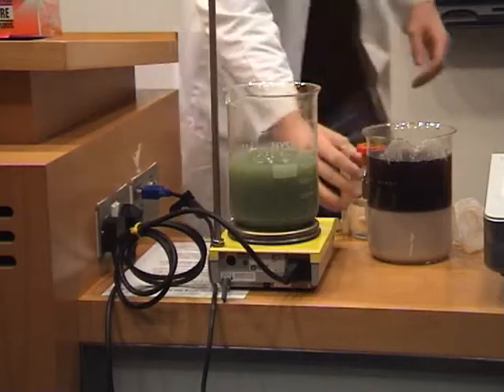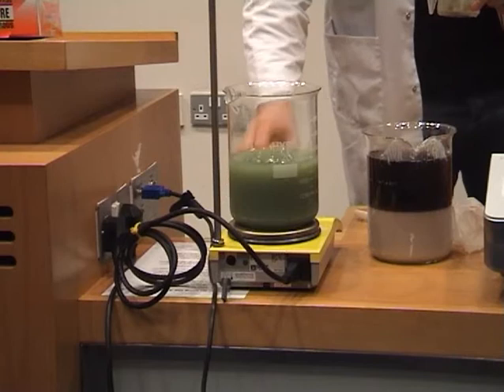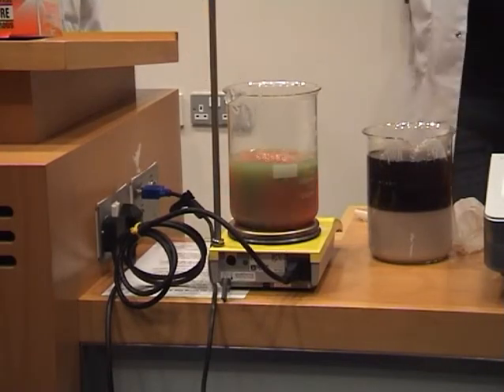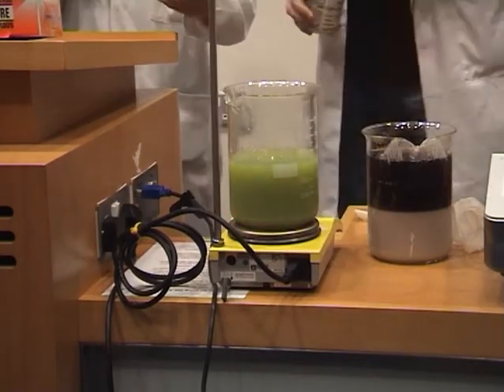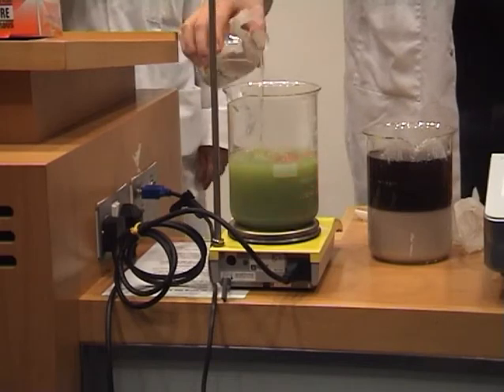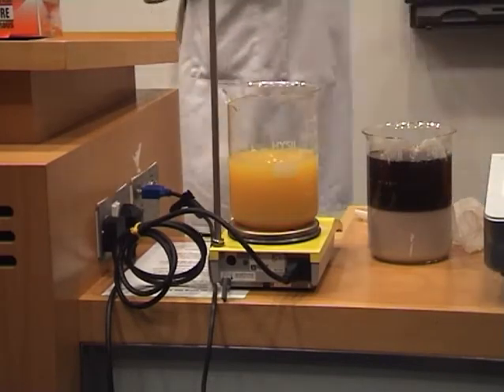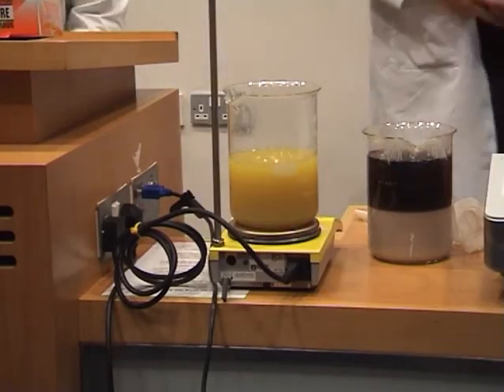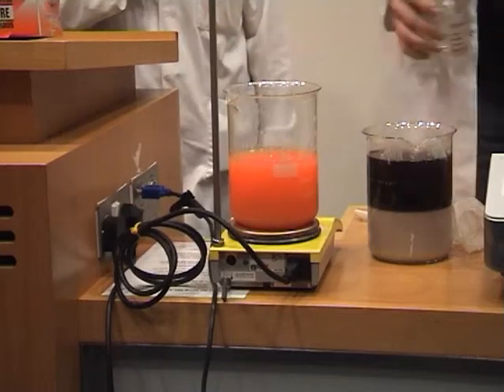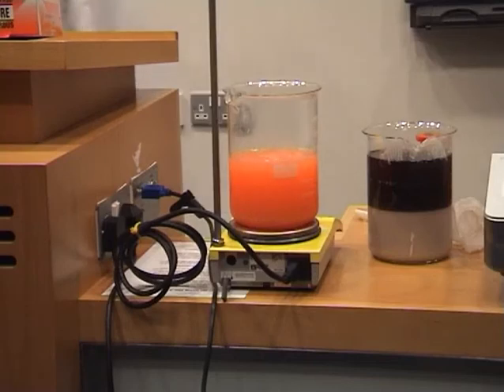So I'm swirling this nicely. Getting that nice acid colour. Yeah, so now just put in a little drop and it turns red. Chuck it in there. Okay, it's red. Put more in. Yeah, Daniel. Red. There. Right. Okay, now we need to get a sample of that.